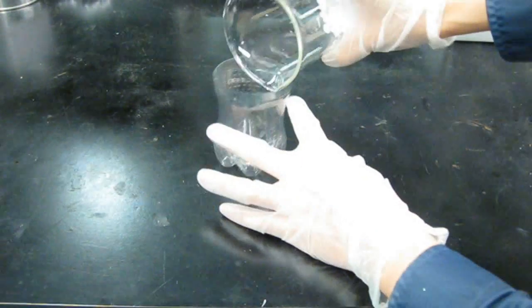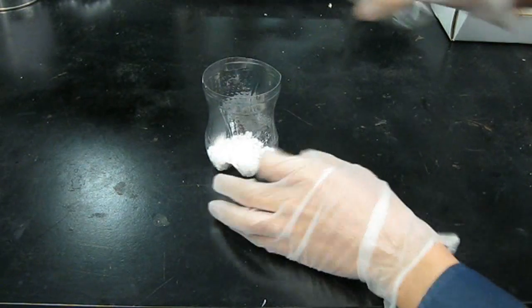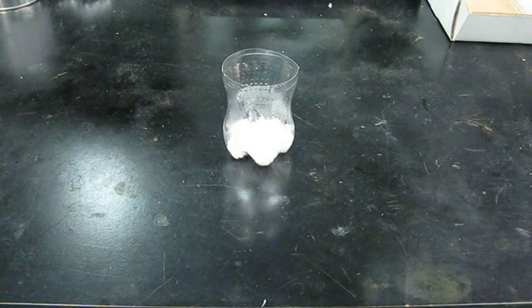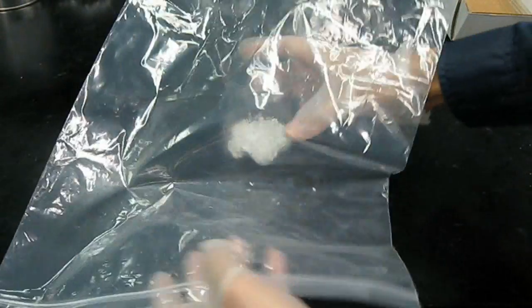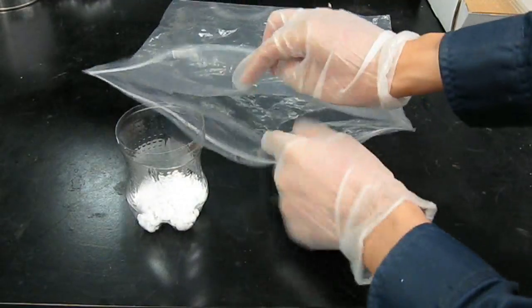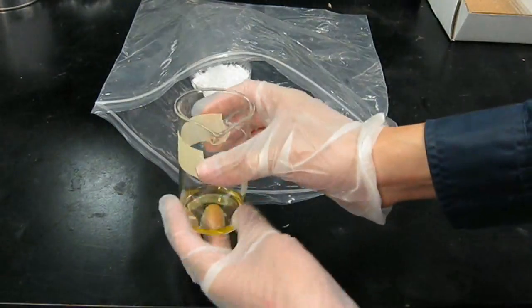Now fill it half way with a drying agent. You can use beads of silica gel or sodium hydroxide. I personally prefer sodium hydroxide since it also absorbs acidic gases like nitrogen dioxide, hydrogen chloride and carbon dioxide. Now simply place both the substance you want to dry and the drying agent in the same resealable bag and make sure it's airtight.